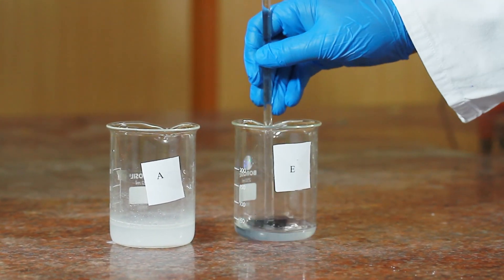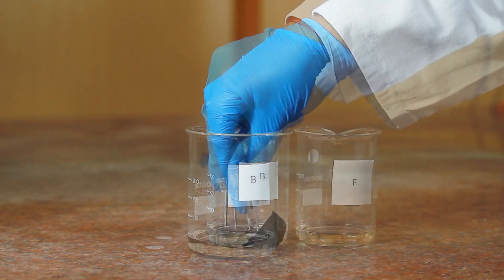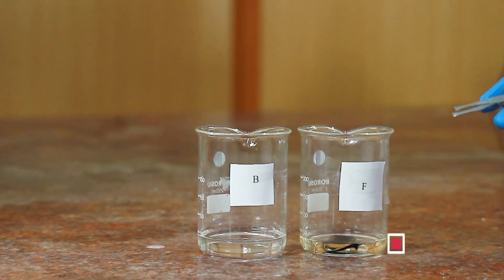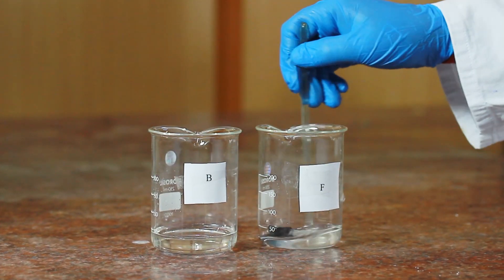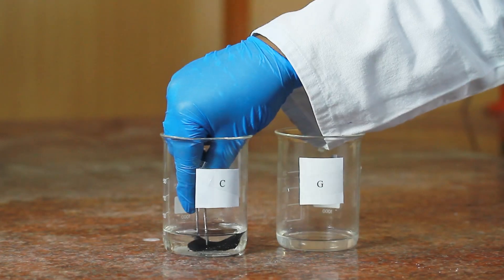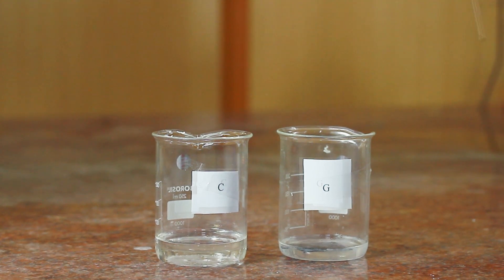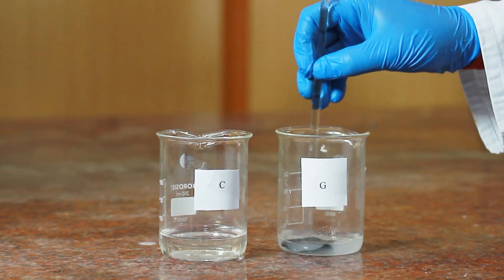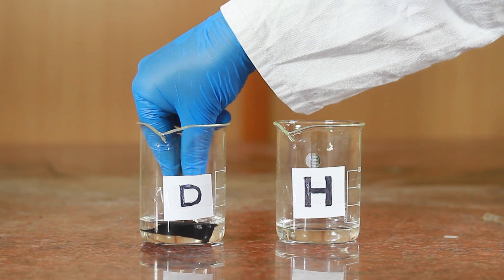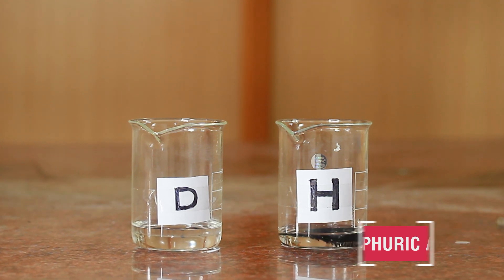Stir it gently with the help of a glass rod. Dip a small piece of black cloth in beaker B, take out the cloth using tweezers and dip it in dilute sulfuric acid in beaker F, and stir gently. Repeat the same process for beaker C with beaker G, and beaker D with beaker H, stirring gently with a glass rod each time.